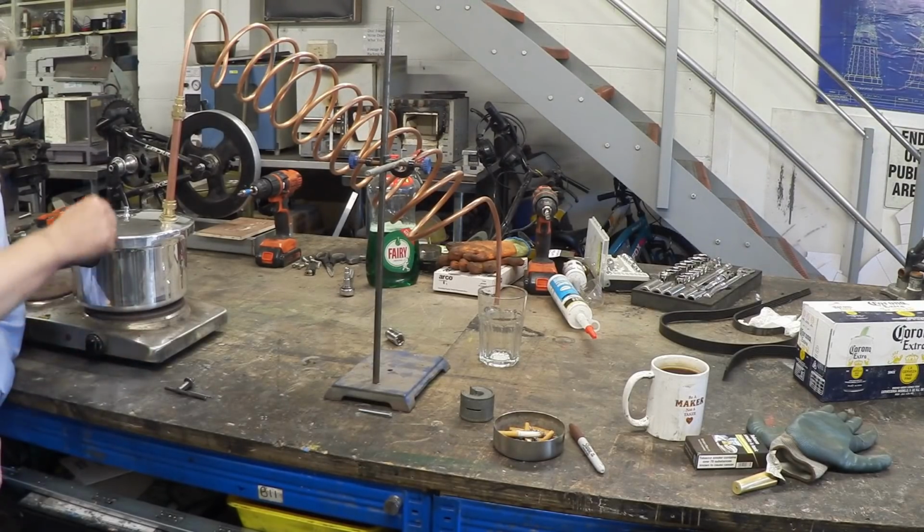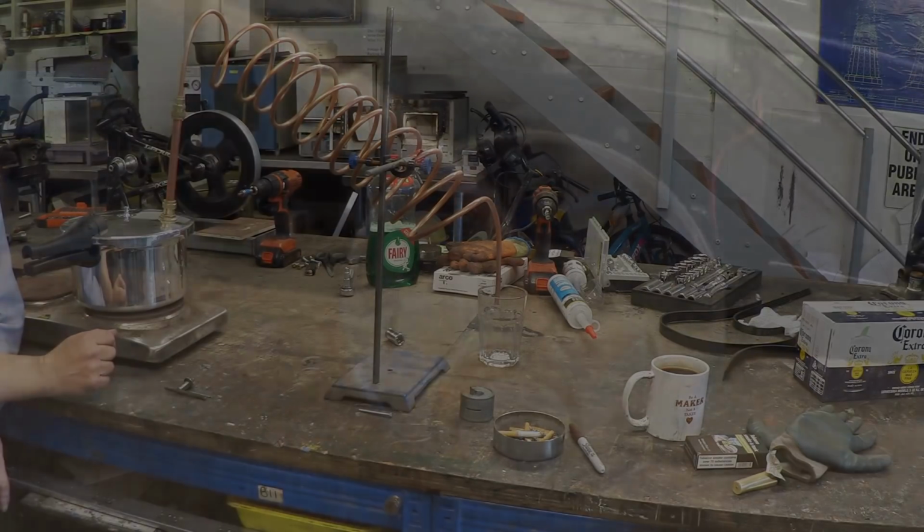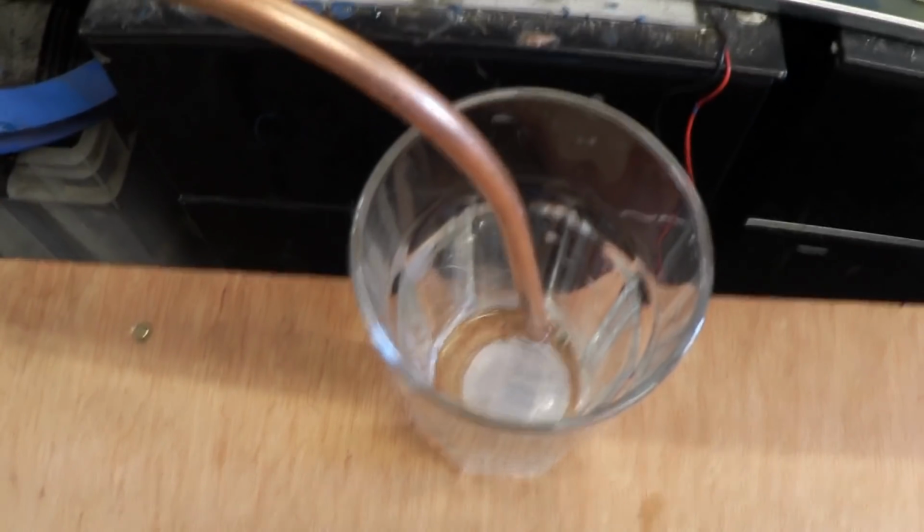And now all we've got to do is put something in there where we want to distill off the, in inverted commas, essential oils. And there it is coming out. That's actually awesome.